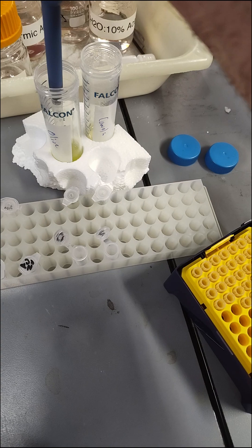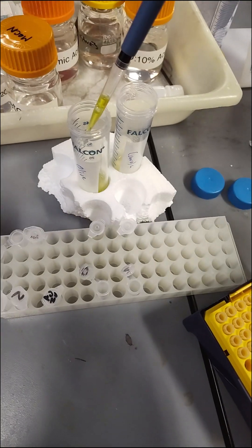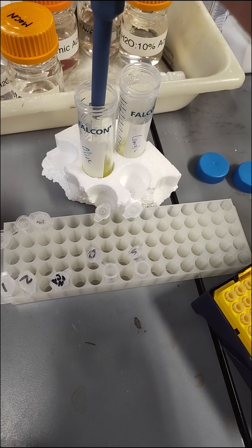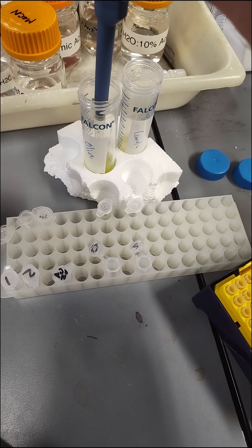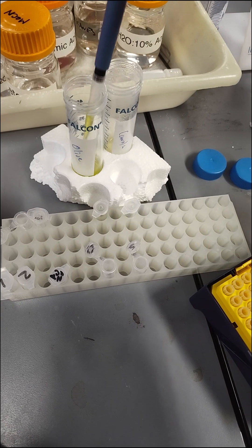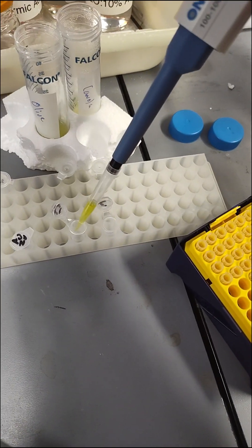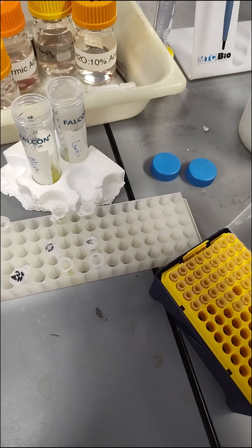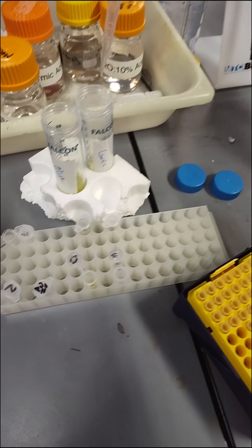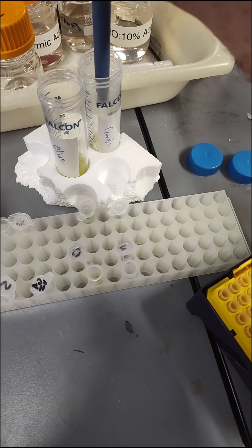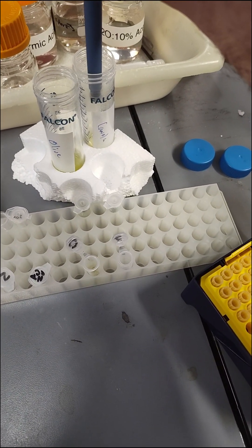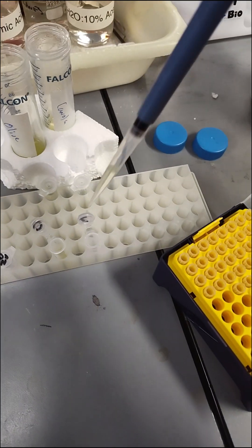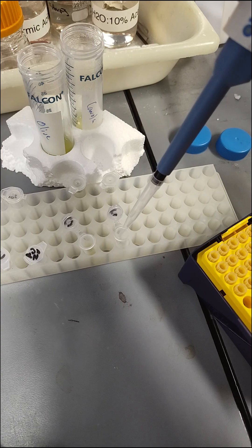So we're going to pipette it up real slow. Real slow because it's so viscous. Now we've got it. And there's the olive oil. And then the same thing for the canola oil. You really got to go slow. And then I usually get a little tap. Perfect.